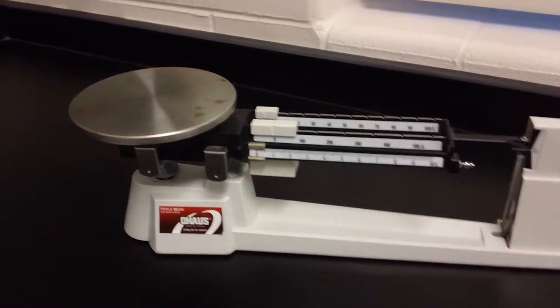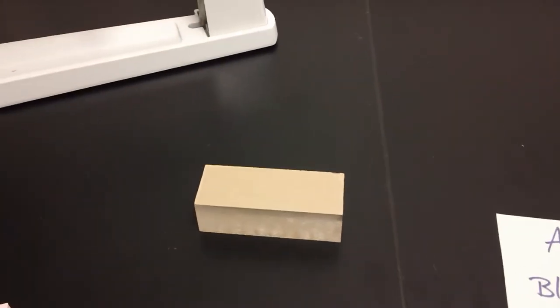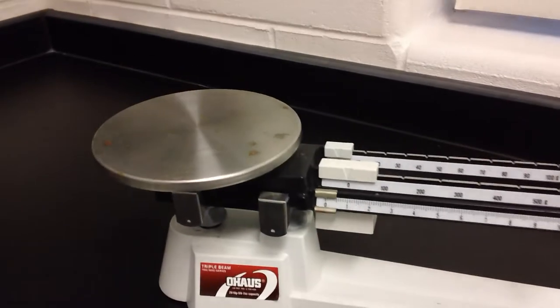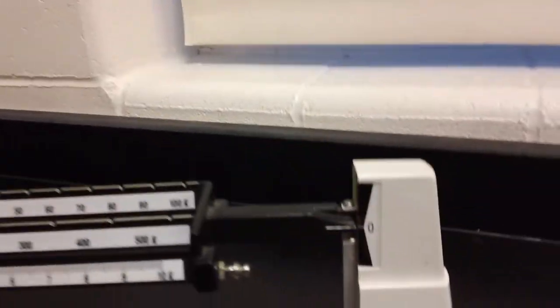Now, before you measure the mass of any object, for the purposes of today, we're going to measure the mass of this block right here. Before we start and get this block on our plate, we're going to make sure that our balance is actually zeroed out.